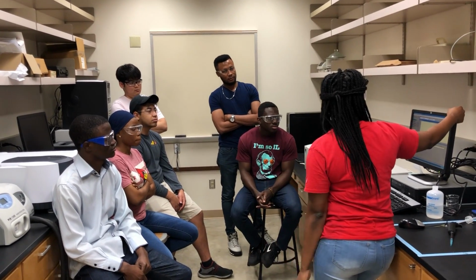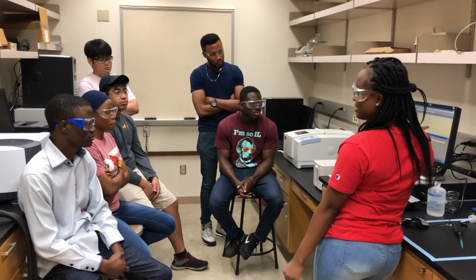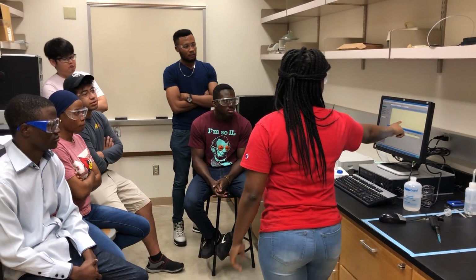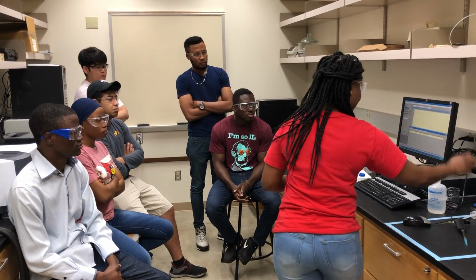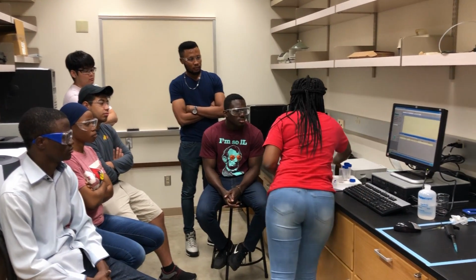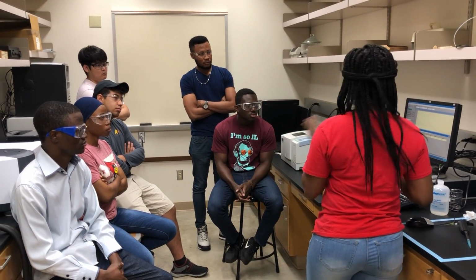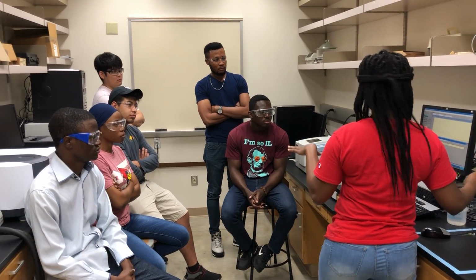So from the UV, let's see the magic again. Boom, you see the difference, right? So knowing this, you know that this particle size is smaller than the previous one we did. This is giving us a very clear understanding of the particle sizes. So it makes characterization using UV for nanoparticles very good, and it's very efficient.